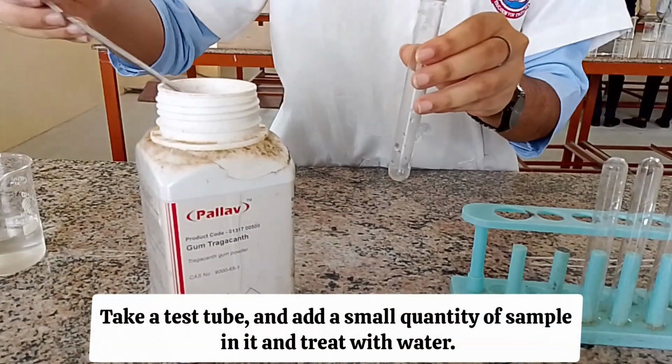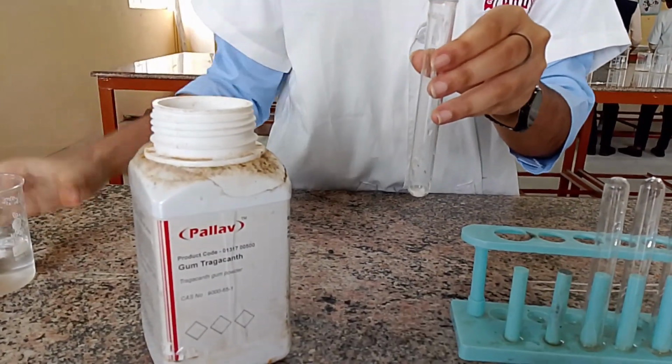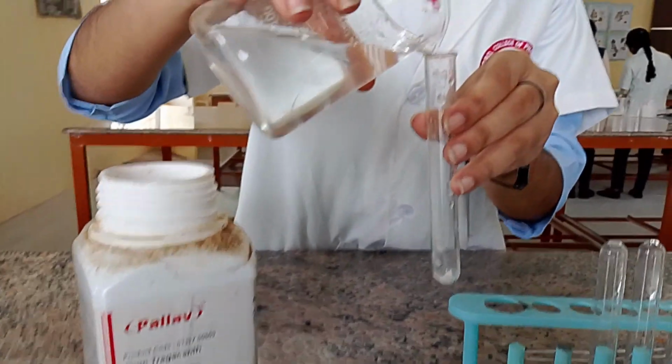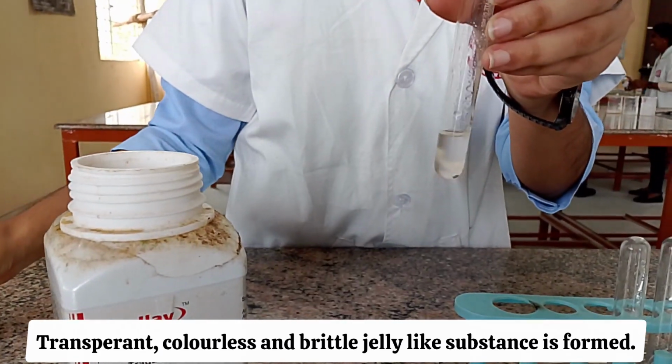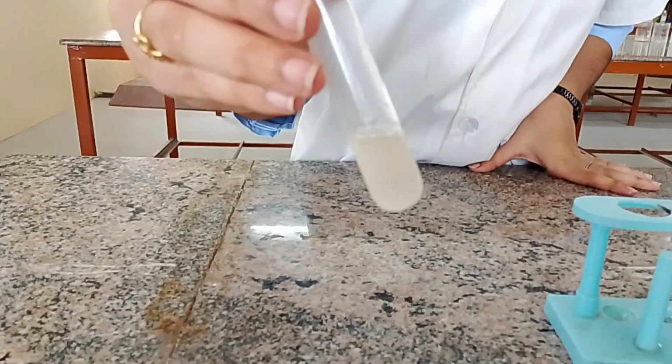Take a test tube and add a small quantity of sample in it and treat with water. Transparent, colorless, and brittle jelly-like substance is formed. Presence of Tragacanth is confirmed.